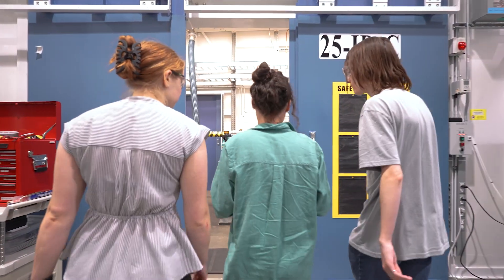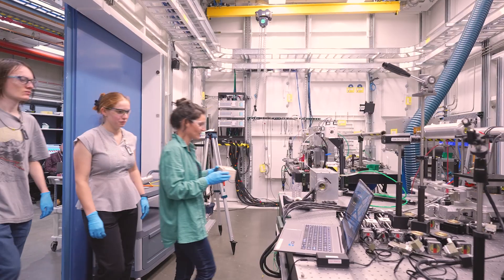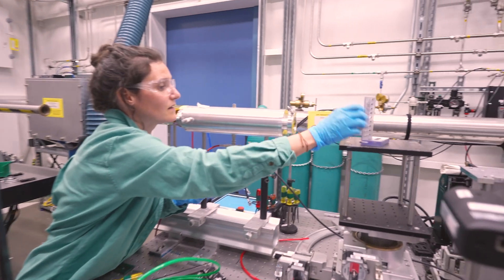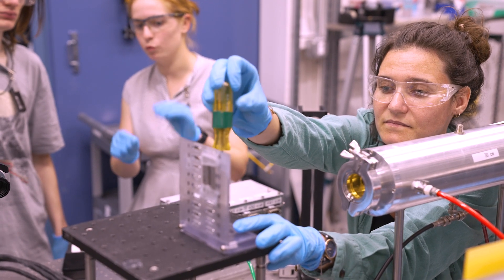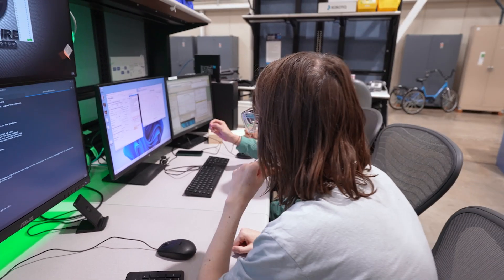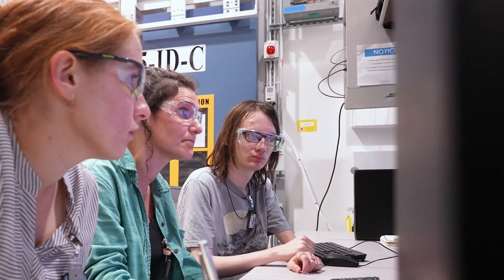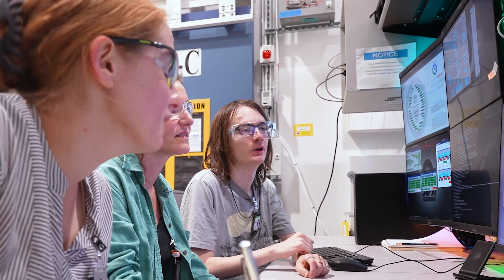We use synchrotron facilities such as the Advanced Photon Source to do two types of analysis. X-ray tomography will give us information on the structure of this soil, and X-ray absorption spectroscopy will give us information about the chemistry. We will especially have information about the chemical form of specific elements, which will inform us about their behavior in this environment.